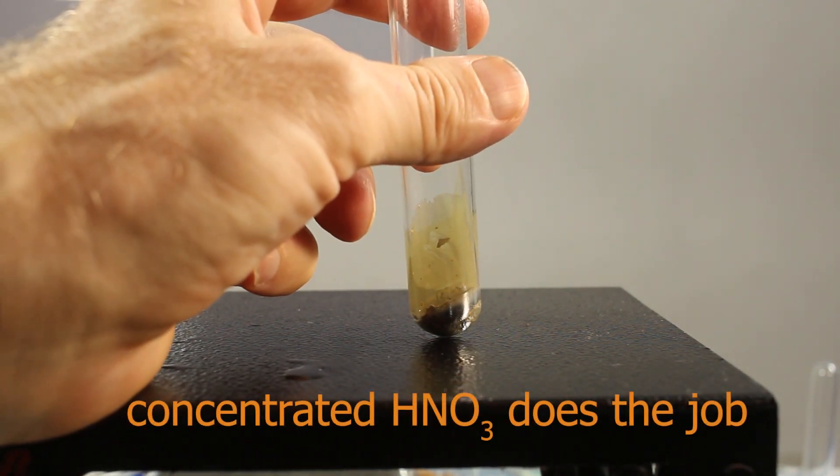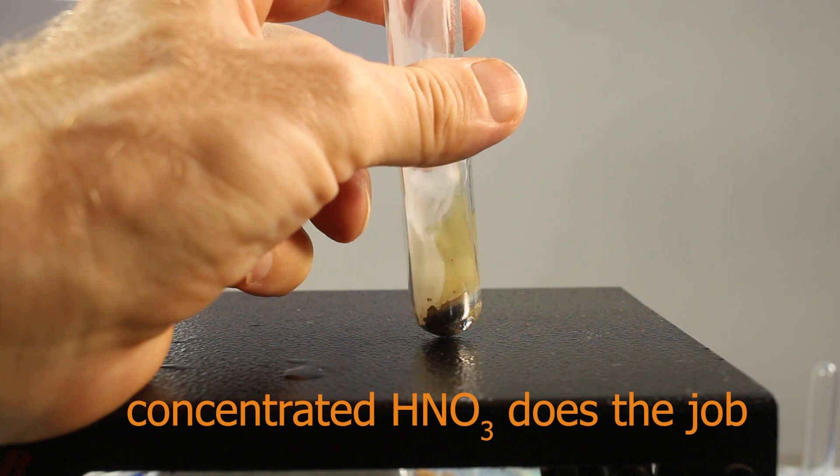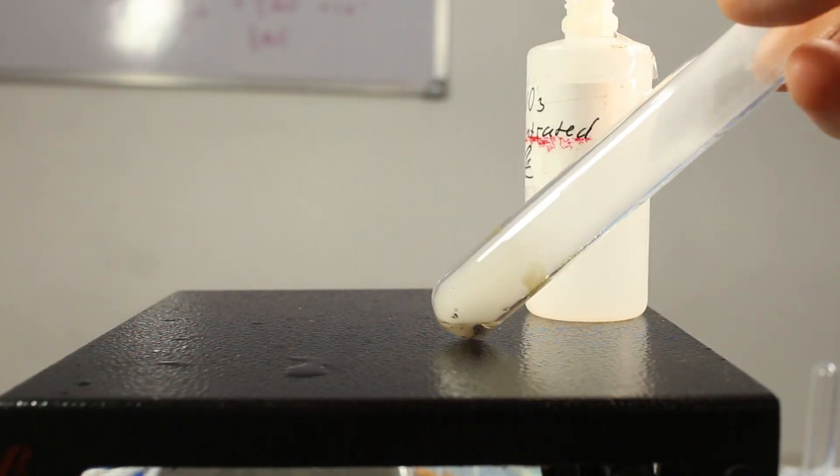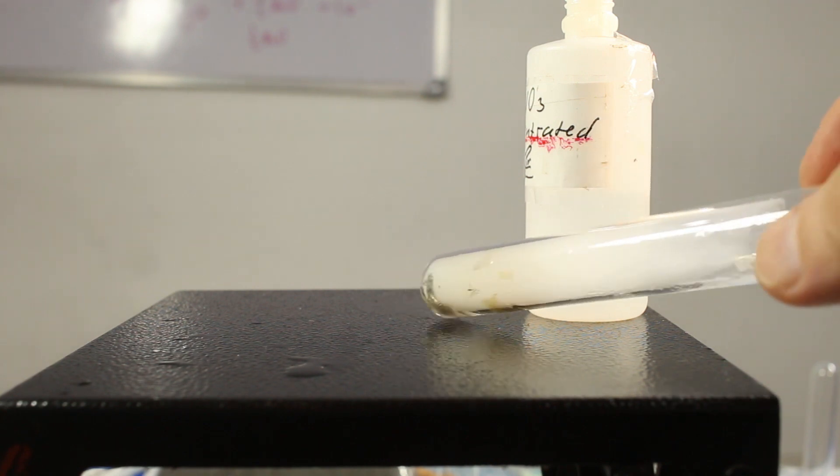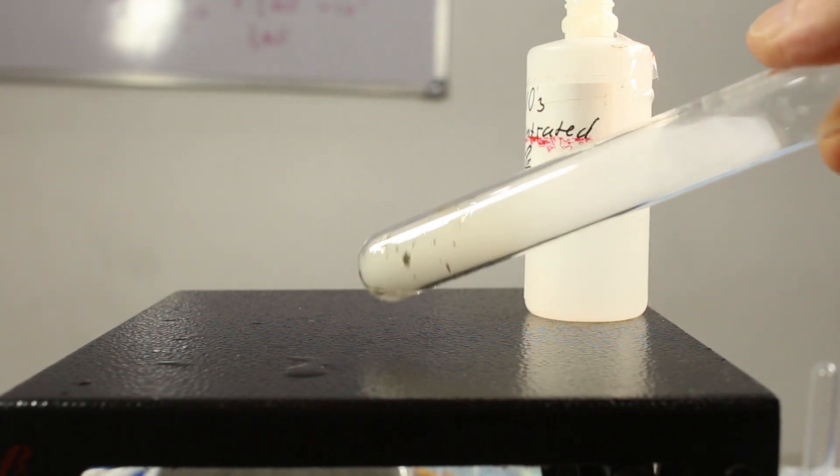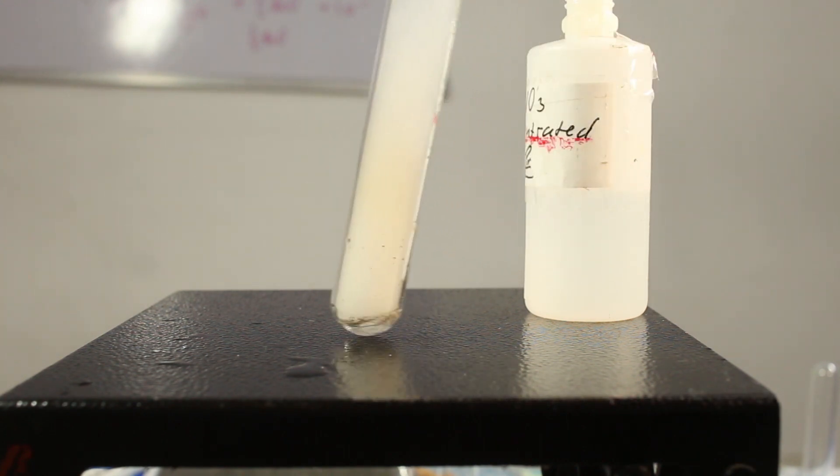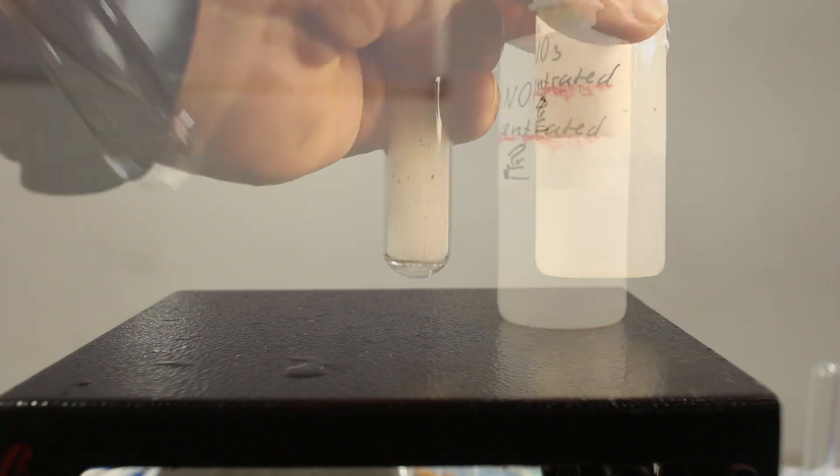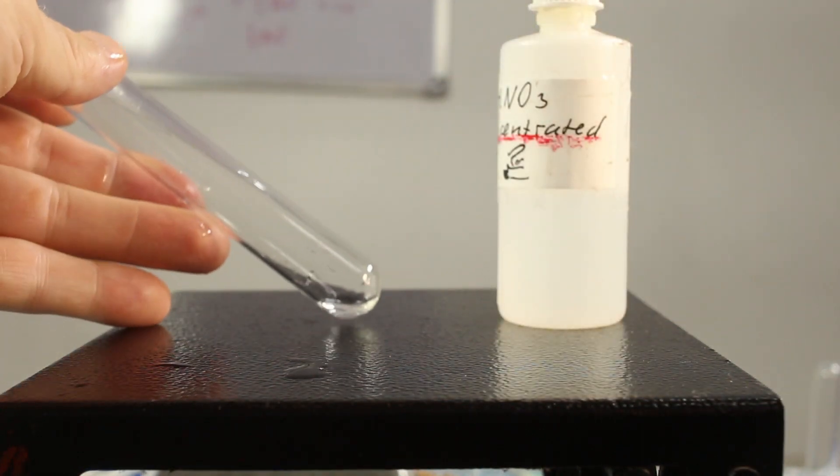Few drops is enough. There are foul gases though formed, but it's micro scale. Just few drops, not a big deal. You see silver dissolves in the acid. After rinsing, it's as good as new.